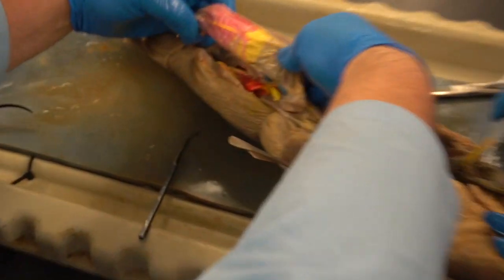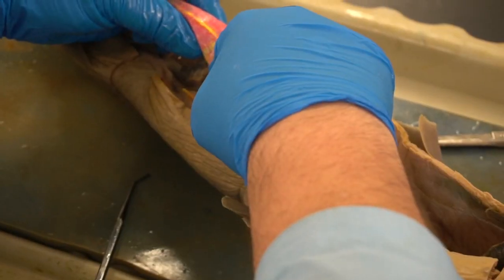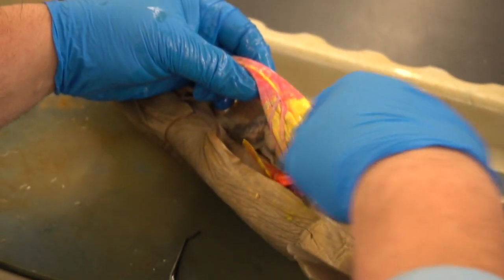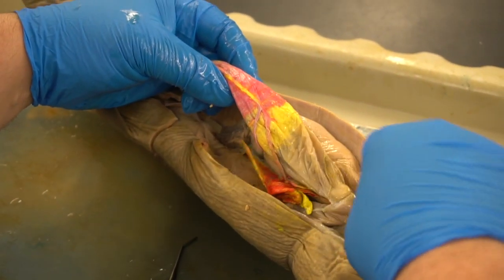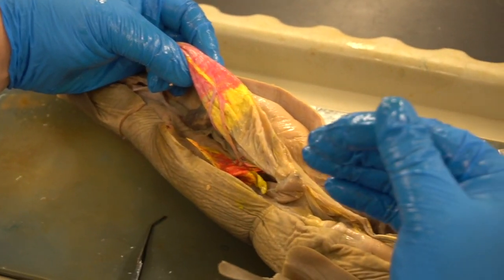You see here in dye, the yellow is the hepatic portal system. So you can see stuff that's getting absorbed. That happens at the upper end of the intestine. It's got to get processed and transferred up, and the liver has to help detoxify things that it ingests.